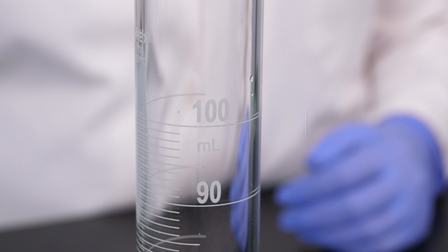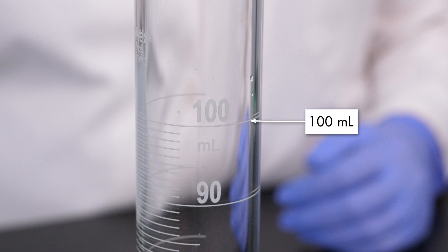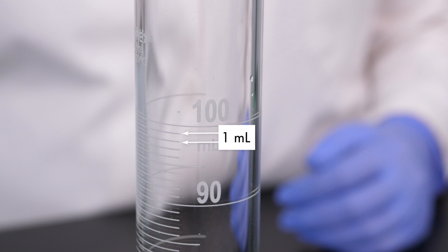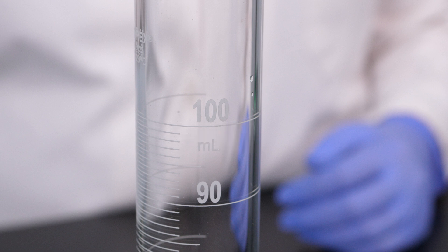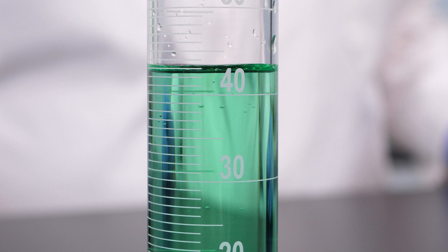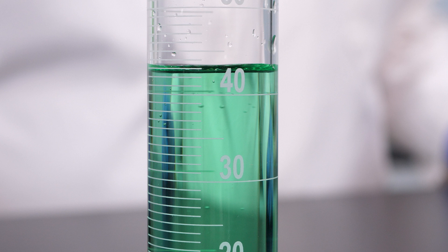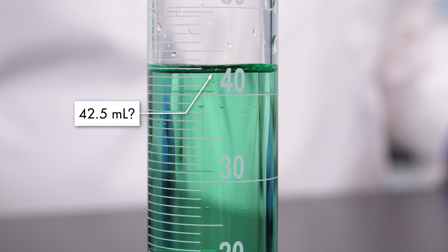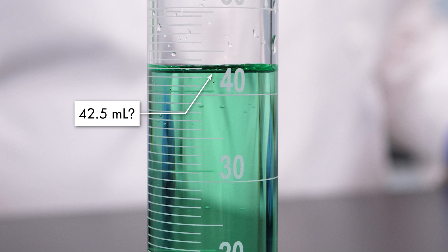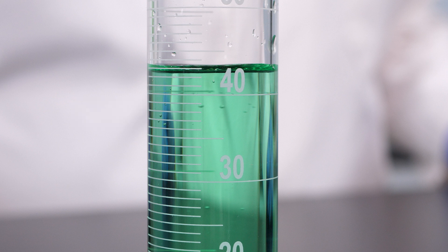The 100-milliliter graduated cylinder is marked in 1-milliliter increments, so it is precise to 1 milliliter — greater precision than the 500-milliliter cylinder. The bottom of the meniscus is about halfway between the 42 and 43 milliliter marks, so we estimate the volume to be about 42.5 milliliters. This measurement is more accurate than the previous ones, but we can be even more precise.